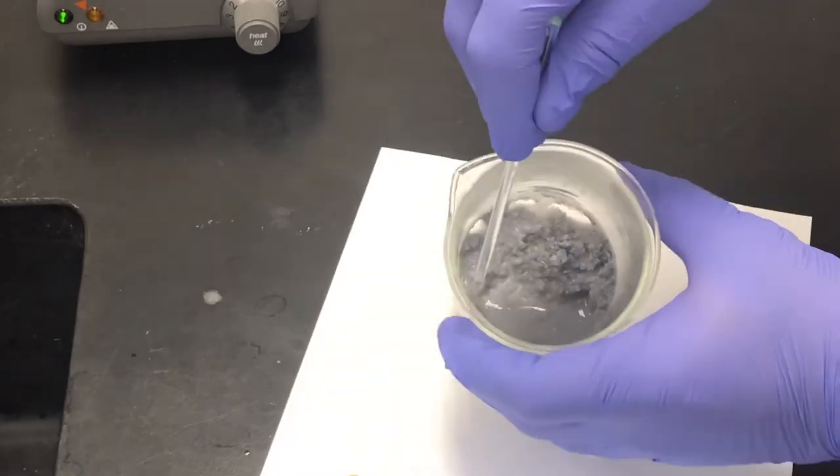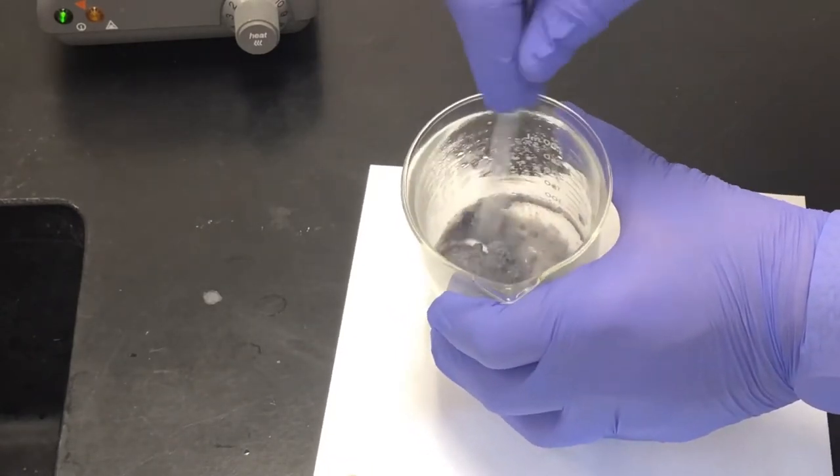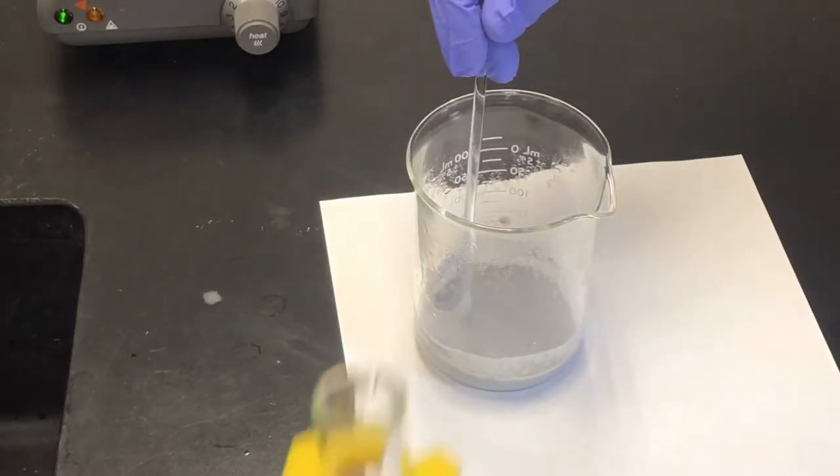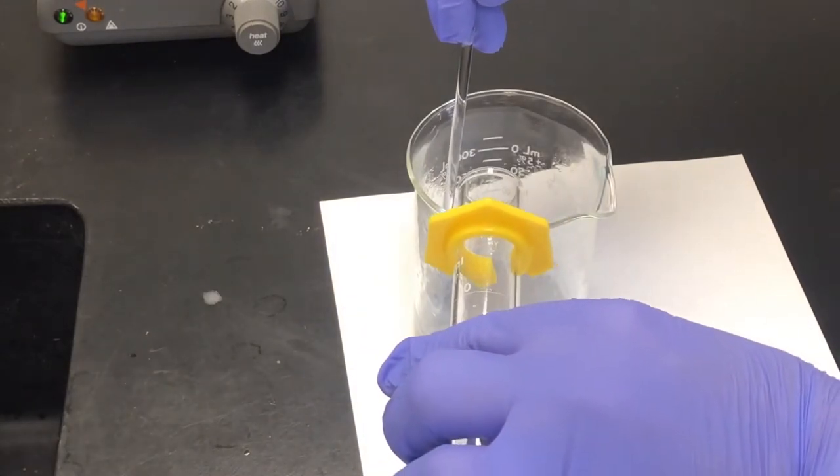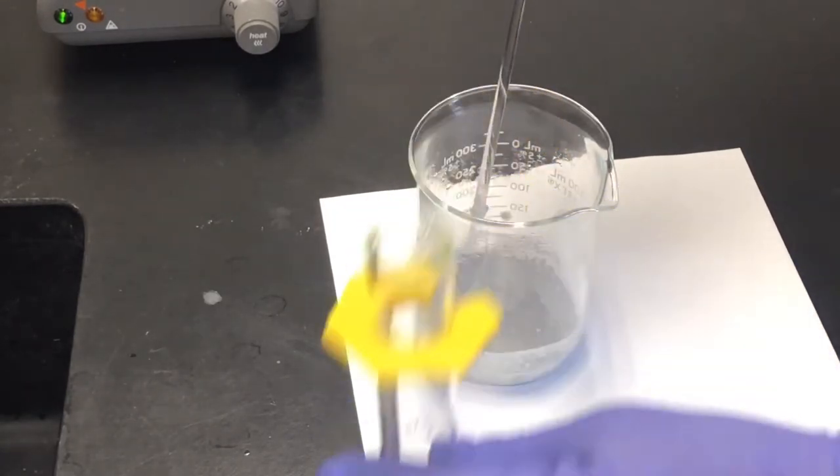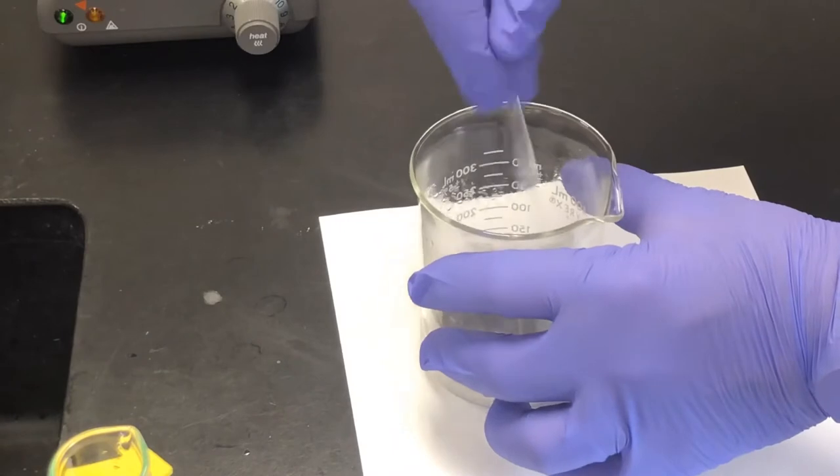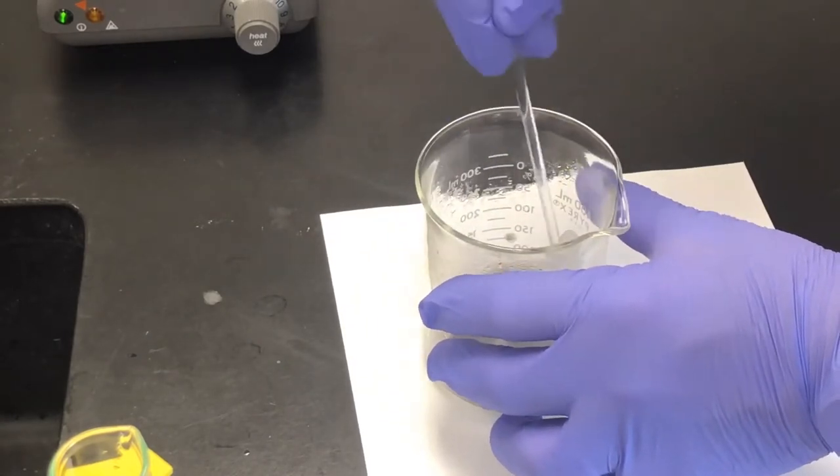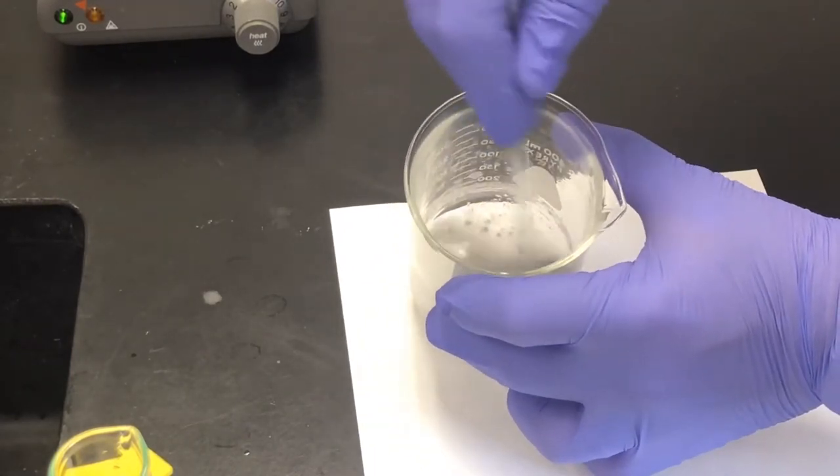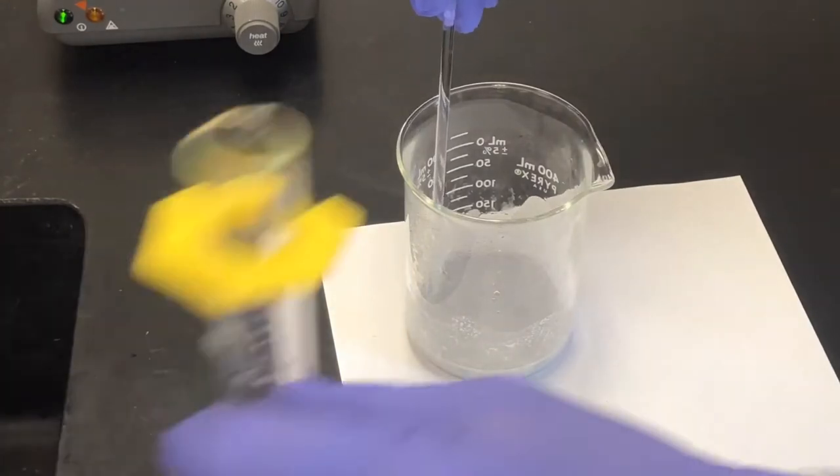So starting to break down just a bit now. Trying to get it all off of the sides. It's starting to break down a bit. We want to let this react very well. Last five milliliters.